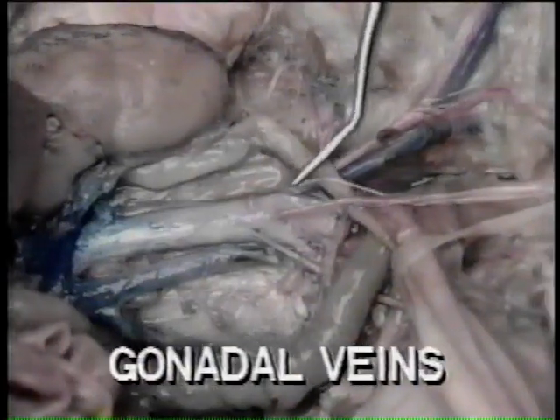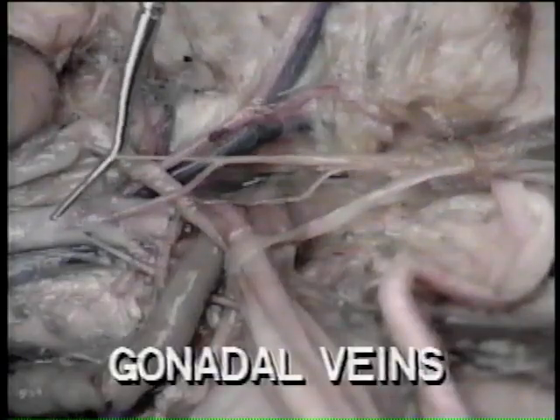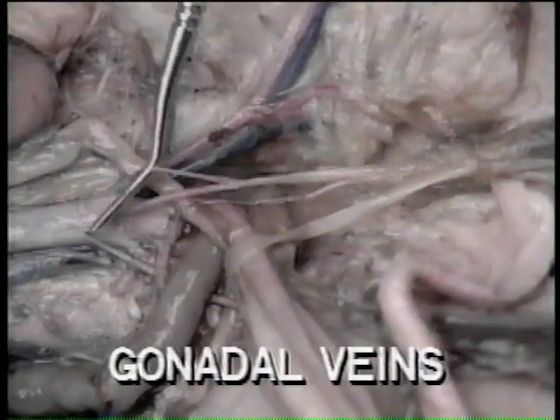Gonadal veins receive blood from the reproductive organs. In the male, these are the spermatic veins. In the female, the ovarian veins.